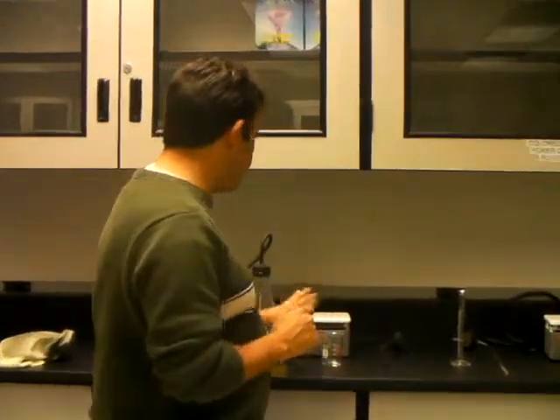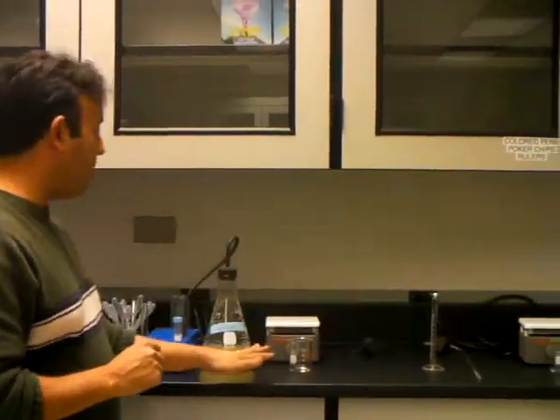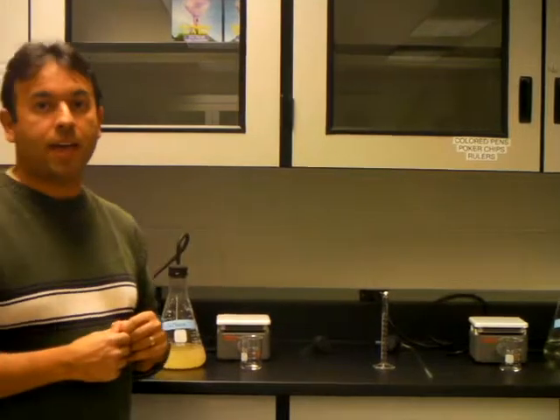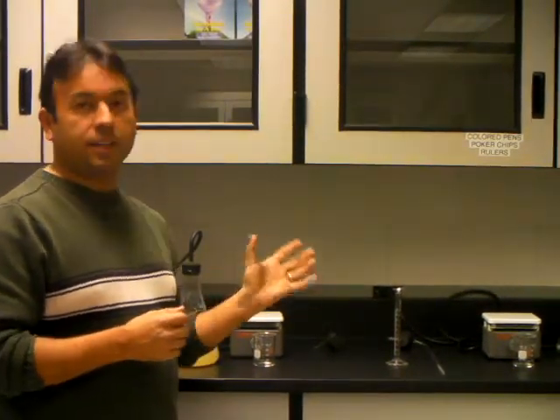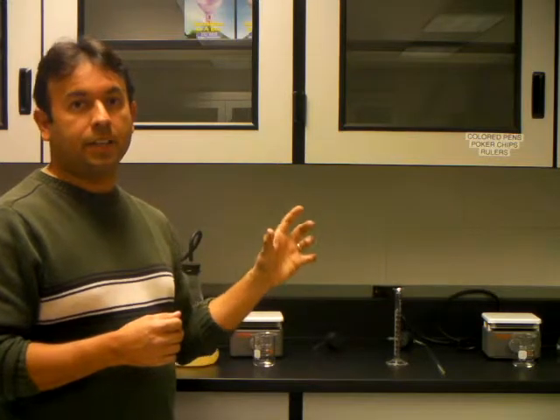Okay, for lab number three, the last part, I usually typically run as a demo. What's going to happen is you're going to have two systems set up on the side, and this is really something that you would do versus them. And this is one of the first things I would probably do just to get everything working.